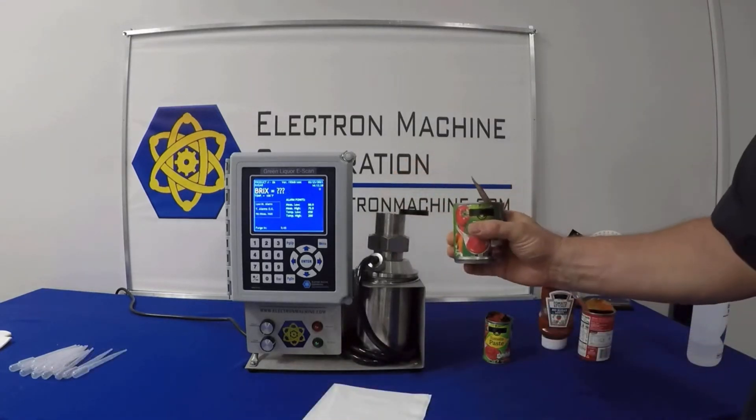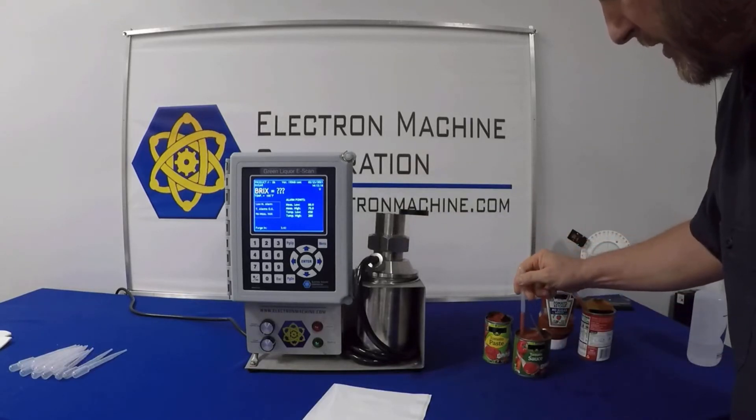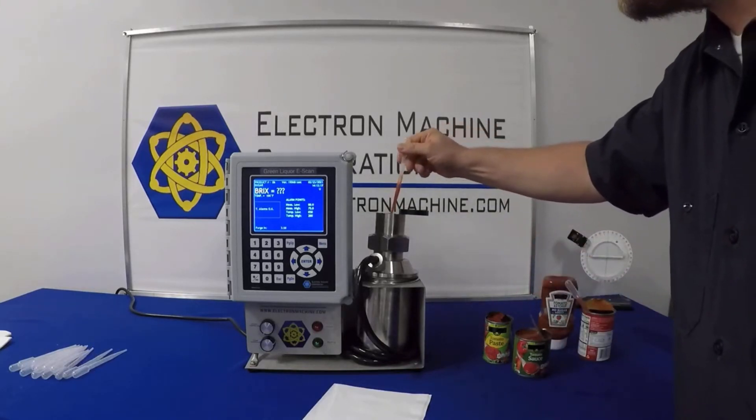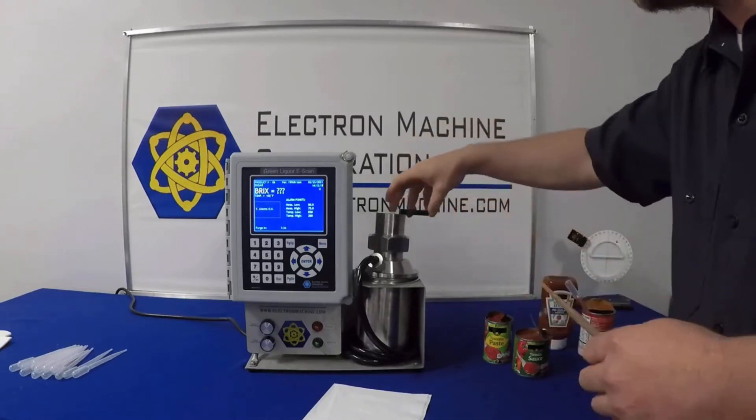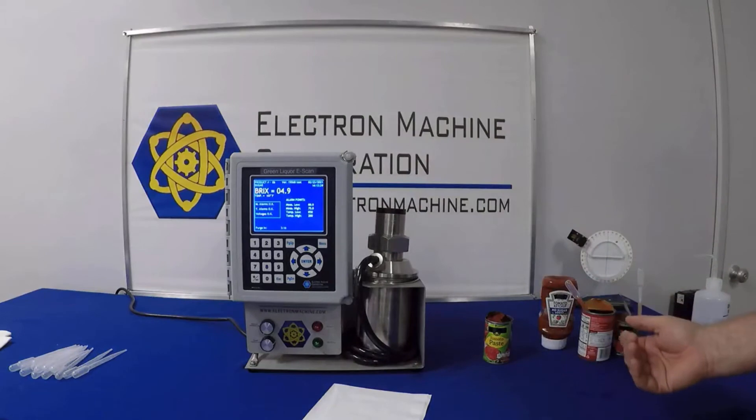For our next product, we're going to try this tomato sauce. This one is considerably less than the condensed soup, and we would expect that. It has more water in it.